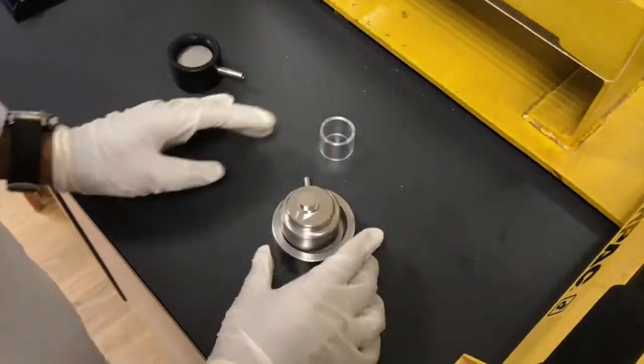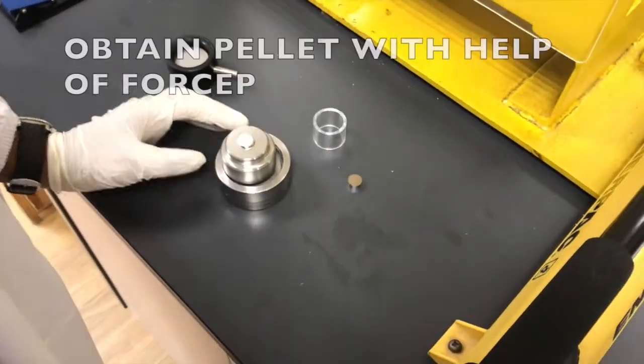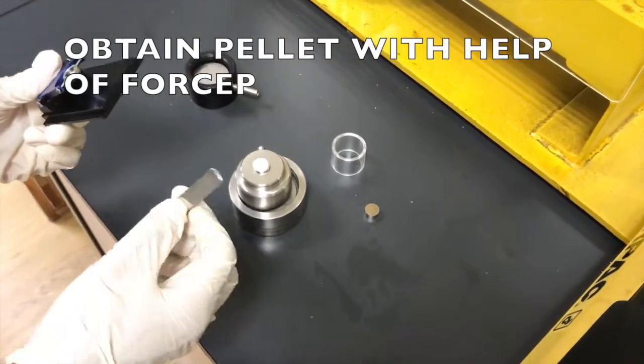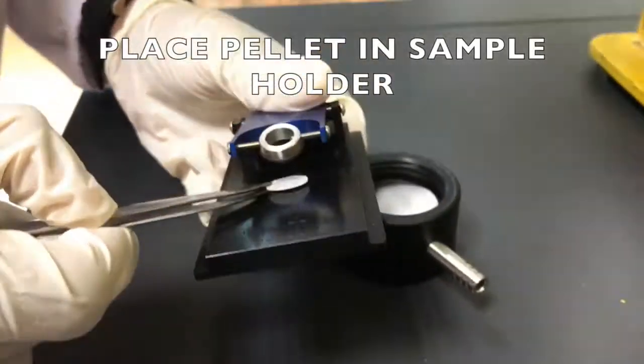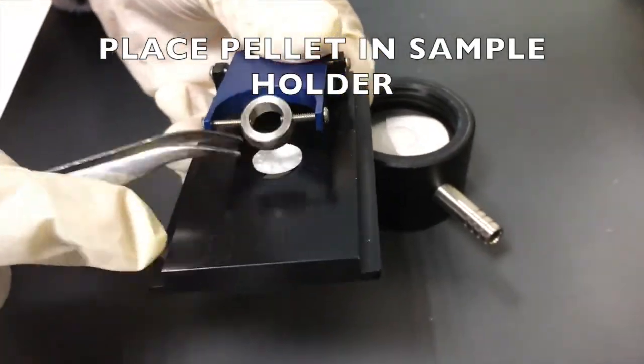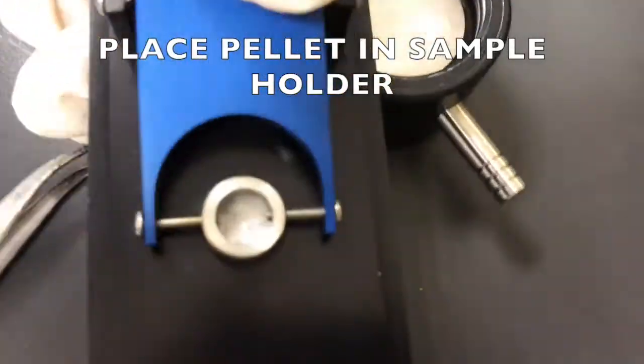Now, disassemble the pellet die set, and voila! You have your sample pellet. Ensure the pellet is about 1 mm thick, as required by ASTM E1252. Using forceps, transfer the pellet into the sample holder.